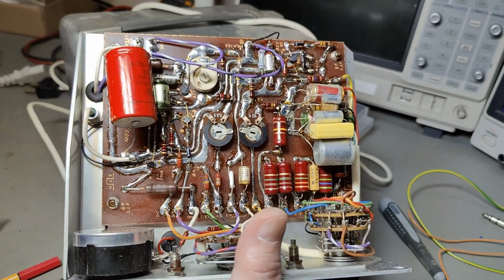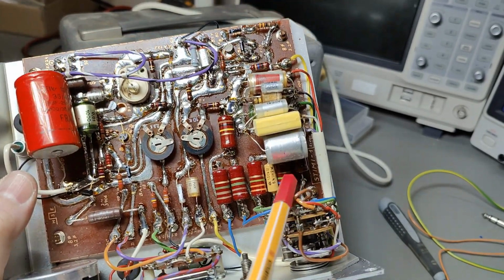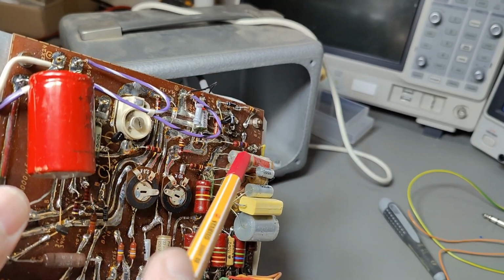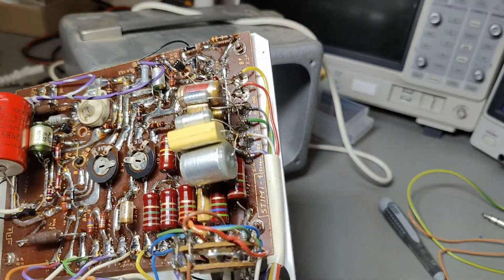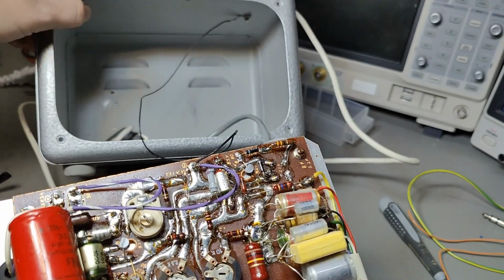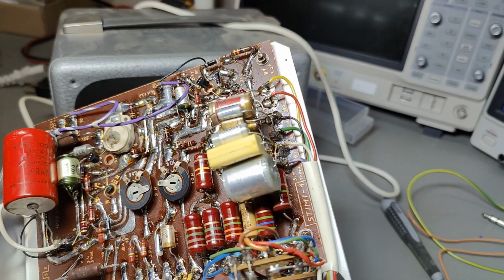Yeah, this potentiometer was loose, so I fixed that one. And yeah, we got the different switches for the different pulses and repeat. Is that one, all those resistors. And look at the capacitors for calibration of the different timing. I mean, isn't that just amazing? Somebody spent quite a lot of time poking around with that. And this long, super thin, flimsy wire here, this is a chassis connection inside here, see? And really? I just love it. And yeah, that is what it is.